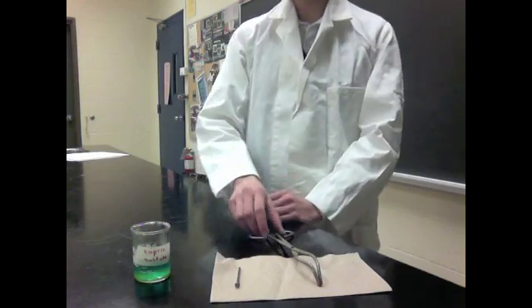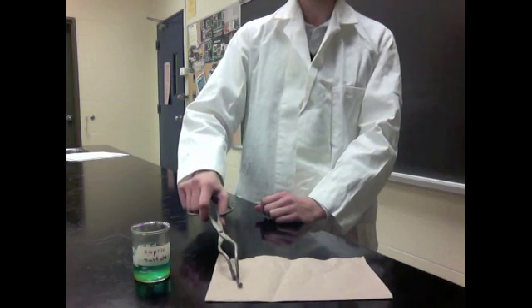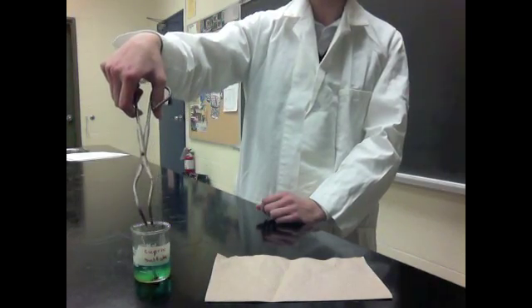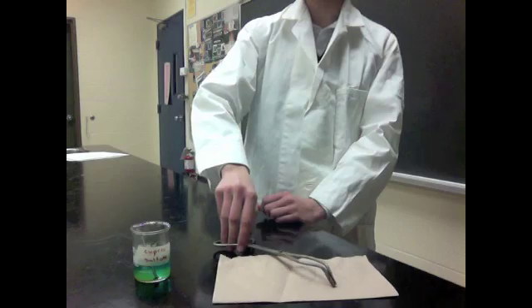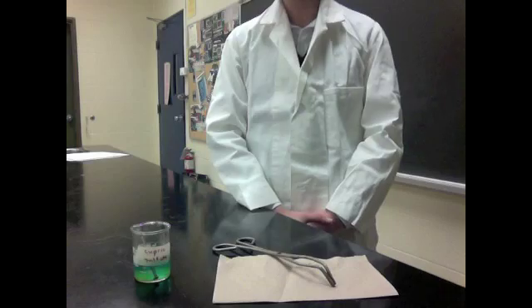Alright, so now we are going to take our tongs, we're going to get the nail, and place it into the beaker of cupric sulfate. And we are going to leave it there for a few minutes and observe what happens.